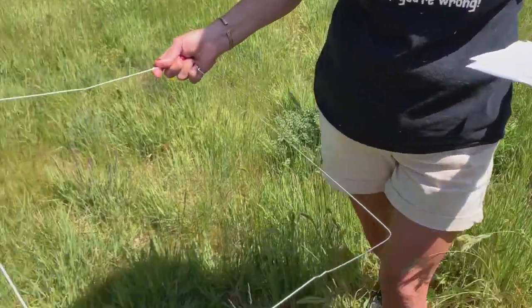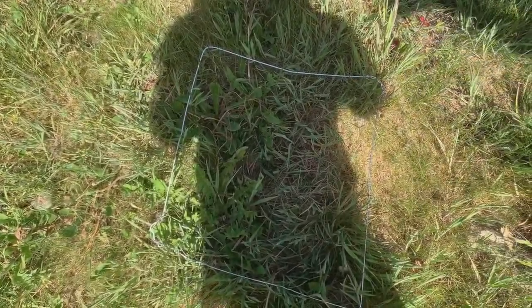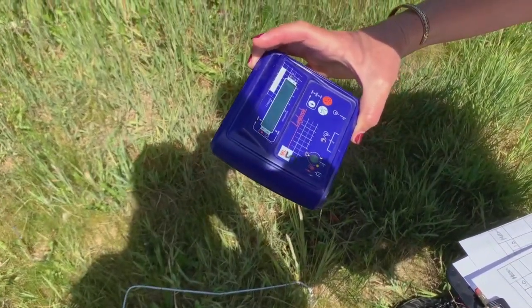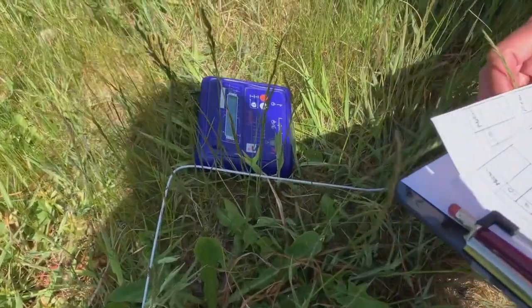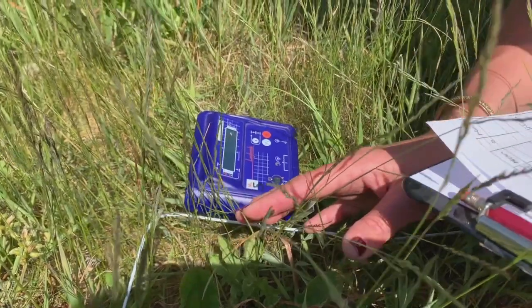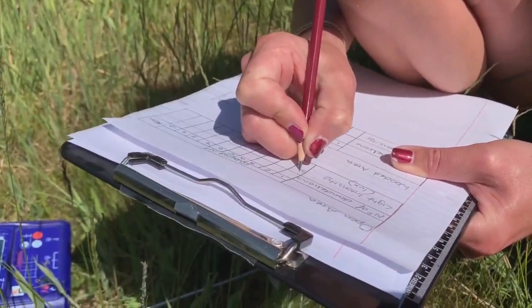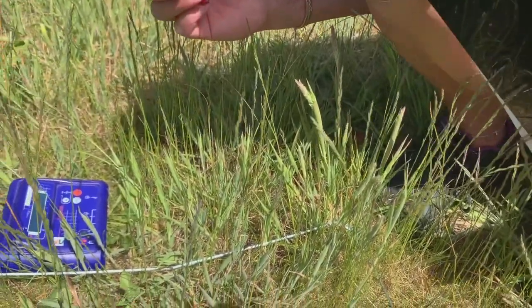Right. I'm going to put my quadrat down there as I explained, and then I need to take, first of all I will turn my light meter on, and let's put it down at the quadrat. That is, without anybody getting in the way, 87,500. That's that done. So now I have to look at the number of dandelions.